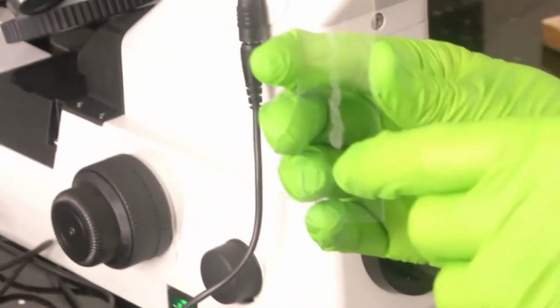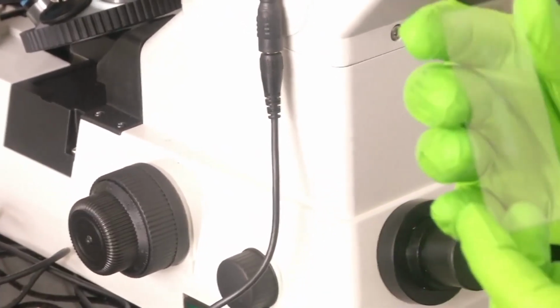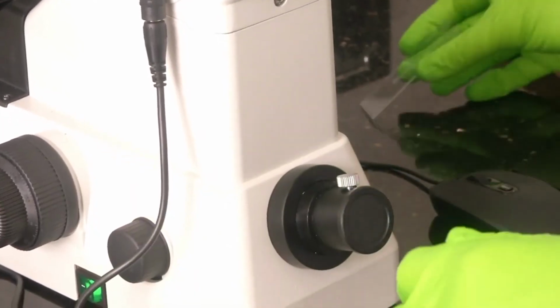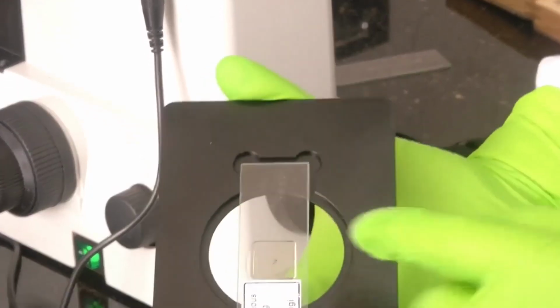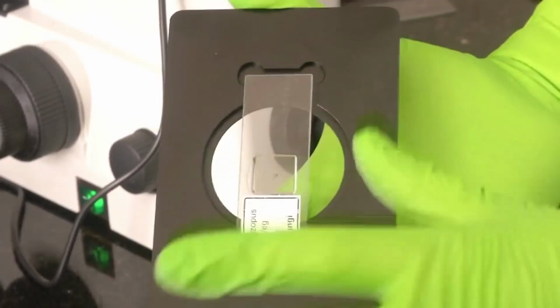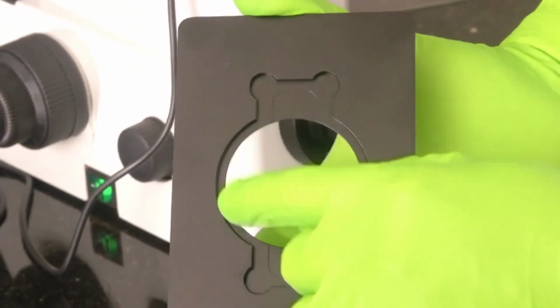This is a blank glass slide. Now the methods have improved, but this is the standard glass slide size which you use to collect samples. So once we have the glass slide with the sample or the cultured cells, we can put it on the sample holder like this. So this portion, if you see, that size is for the glass slide. Now if I remove the glass slide, you see a circular portion, right?